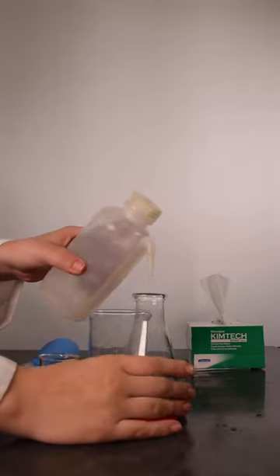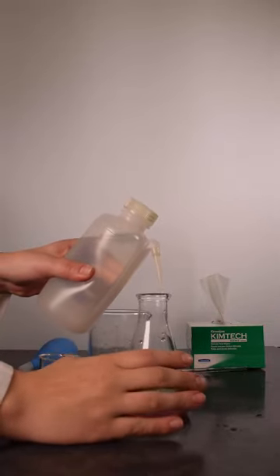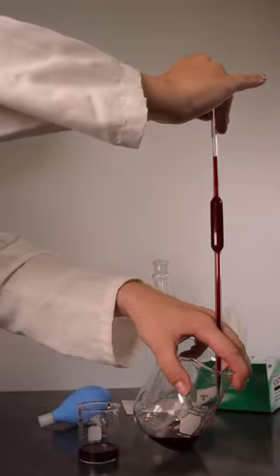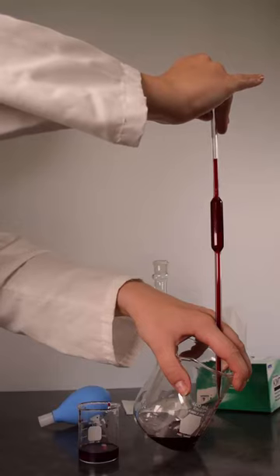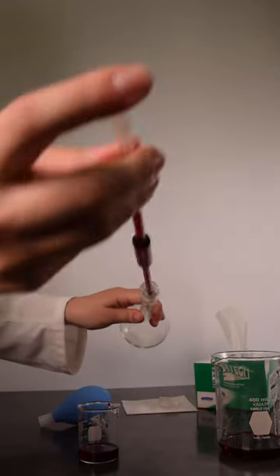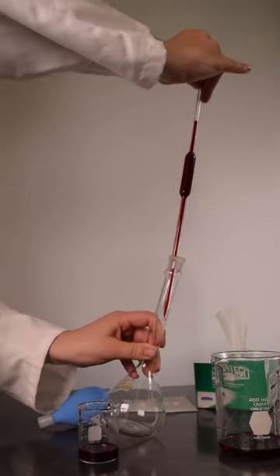It is a good idea to rinse down the inside of the flask with deionized water after delivering an aliquot. An aliquot can also be delivered to a volumetric flask. After draining to the calibrated mark, place the pipette inside a volumetric flask, taking care not to touch the pipette tip where the stopper will be placed.